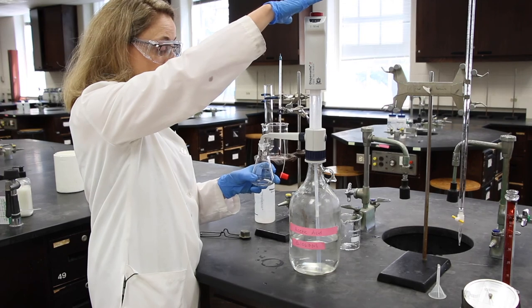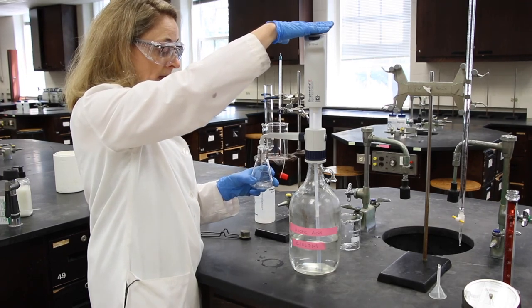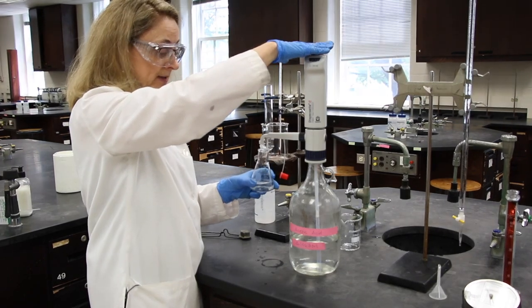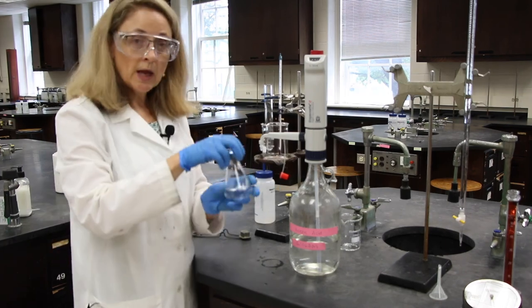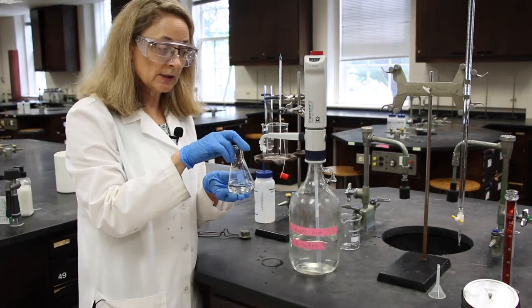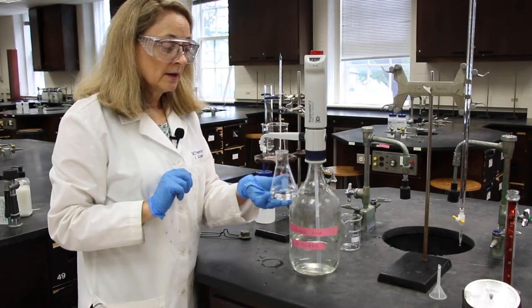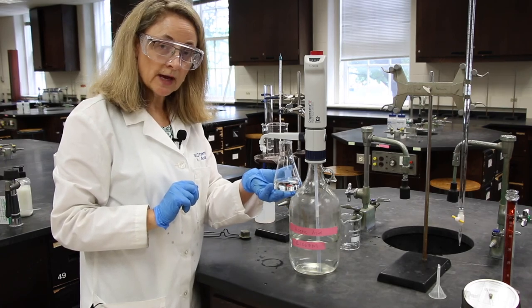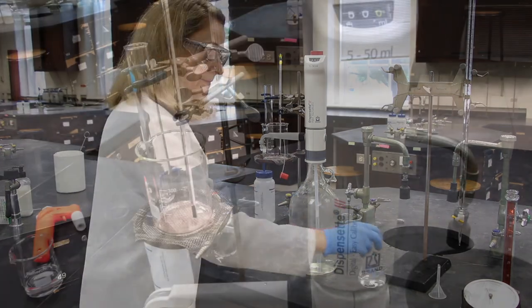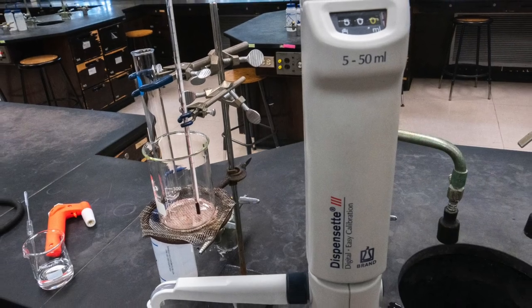And then you'll put the piece of equipment that you want to deliver your solution to. In this case, it's an Erlenmeyer flask. And gently press down on the barrel. And you have 50.0, three sig figs, milliliters of solution in your Erlenmeyer flask.